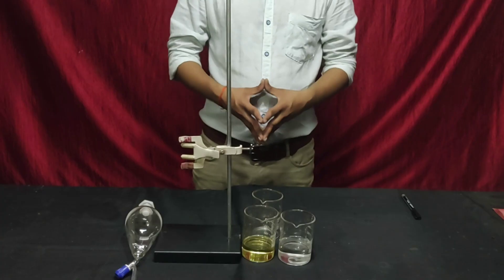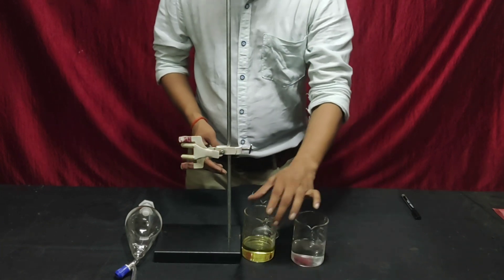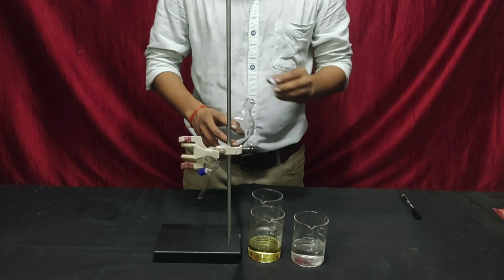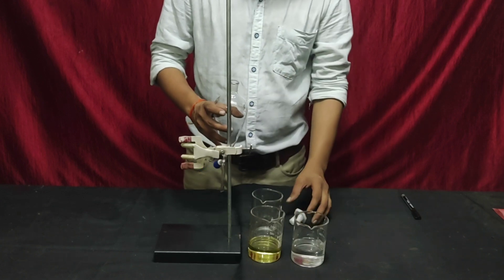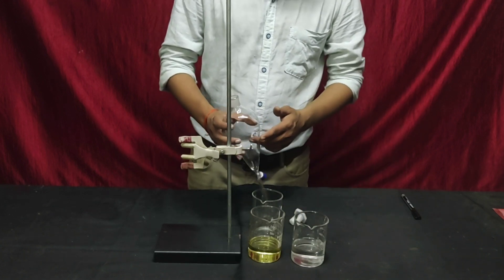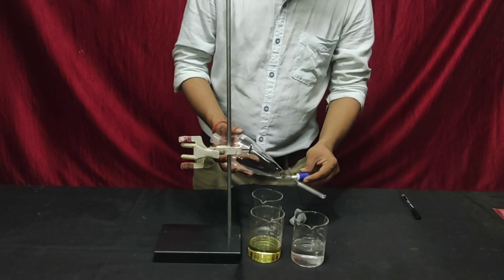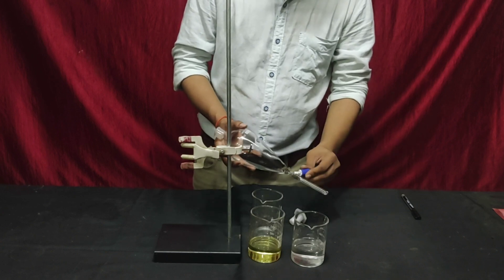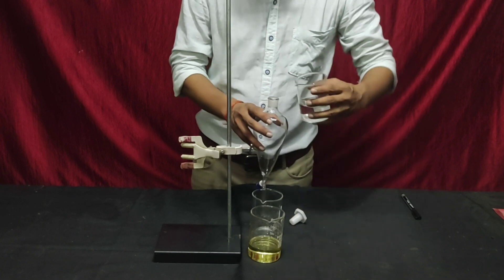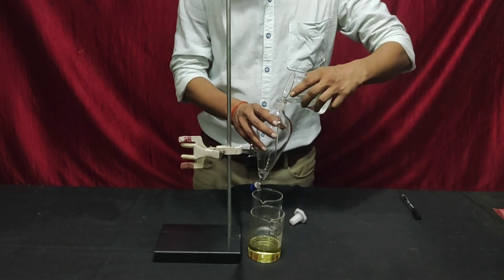How to proceed? Take equal volumes of water and oil and transfer this content into the separating funnel. Care must be taken that the stopcock is closed before transferring the content into the separating funnel.